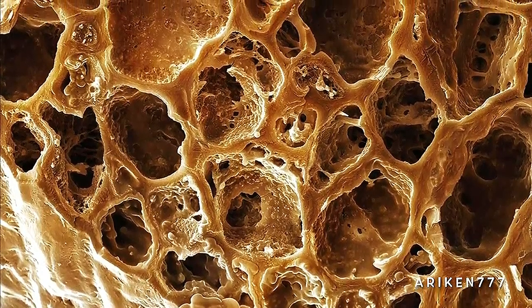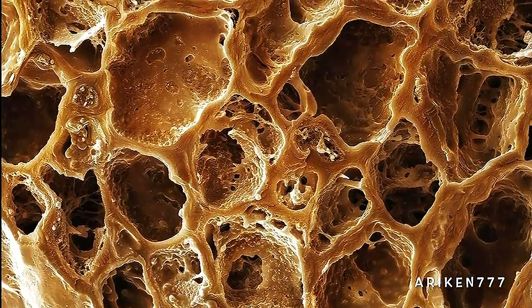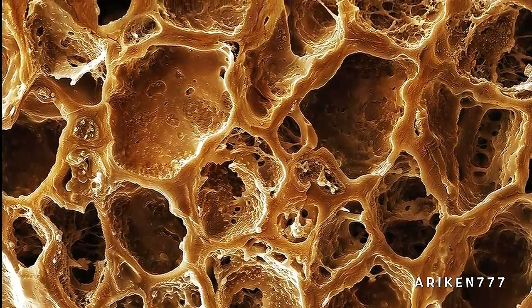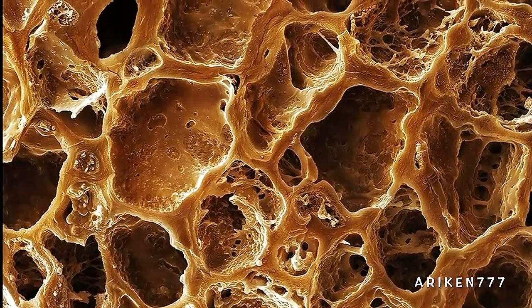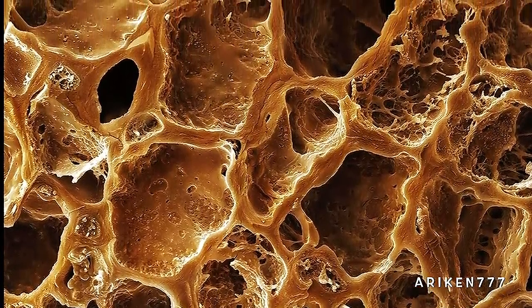A section through a roasted coffee bean reveals the internal structure. This bean contains the stimulant drug caffeine. This and other soluble chemicals are extracted from ground roasted coffee beans using hot water and drunk as a beverage.